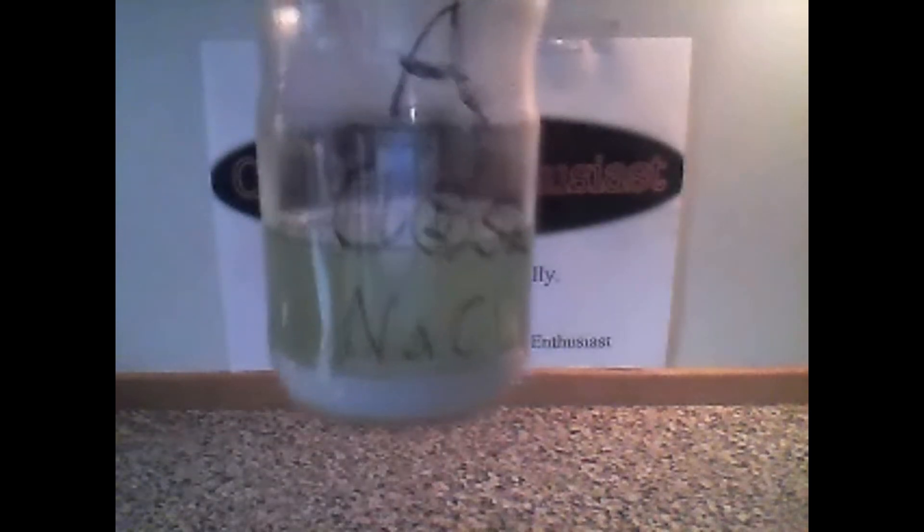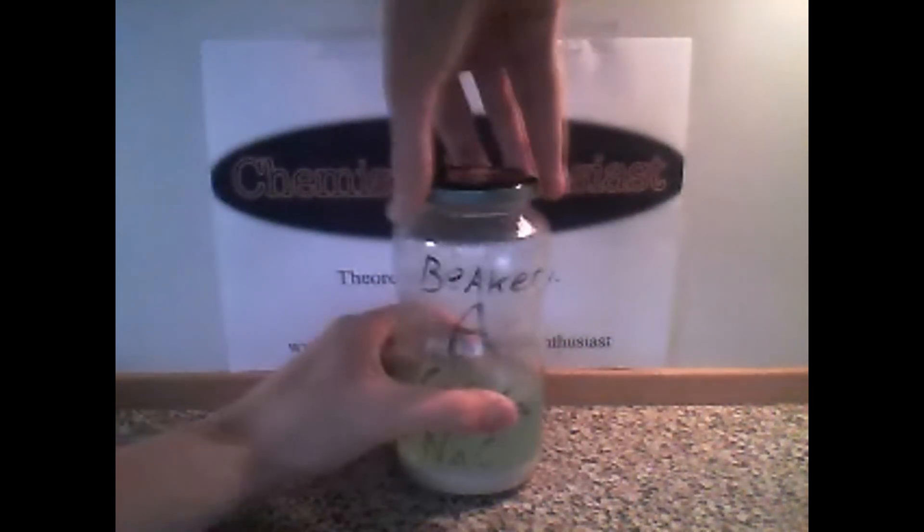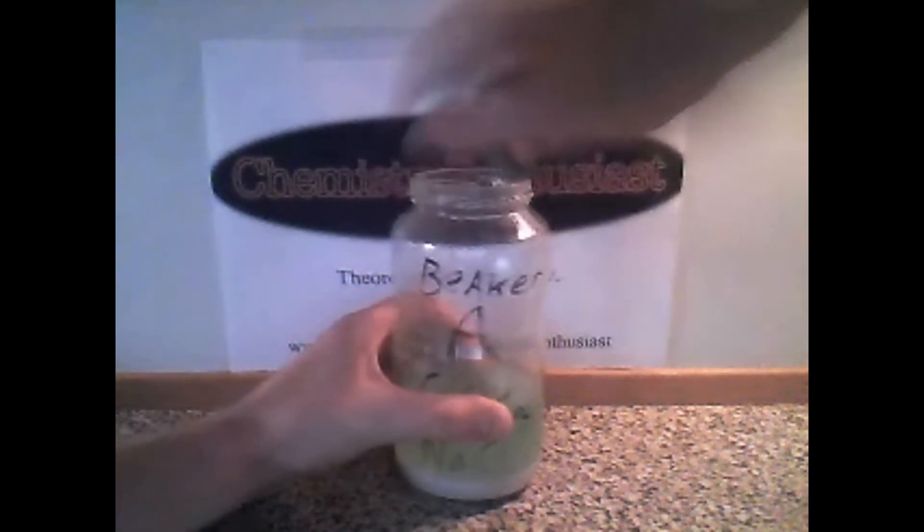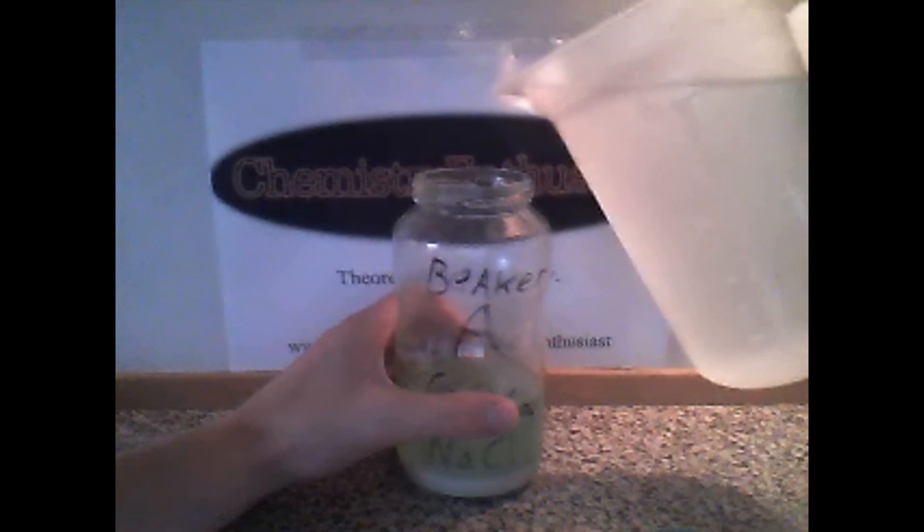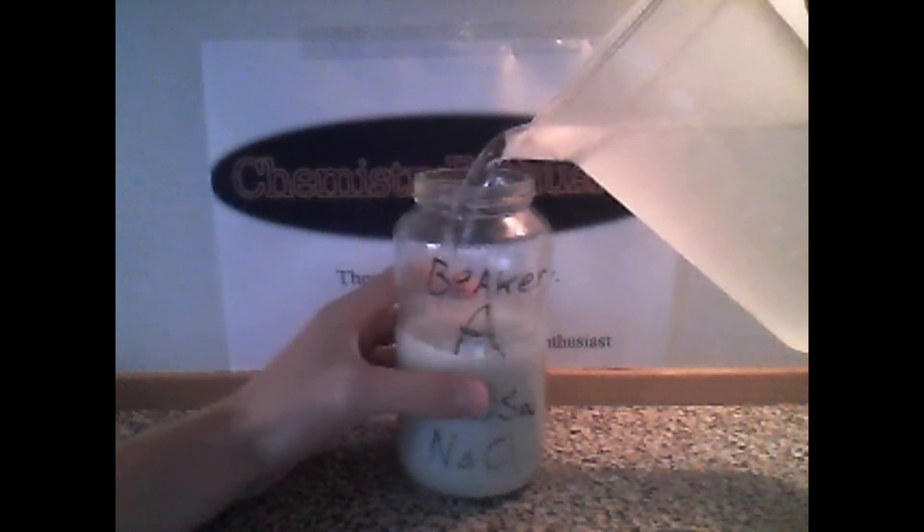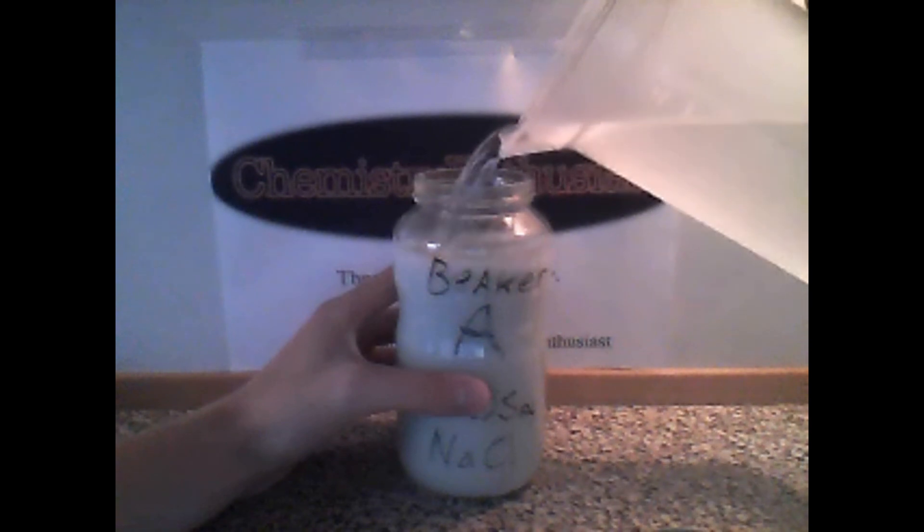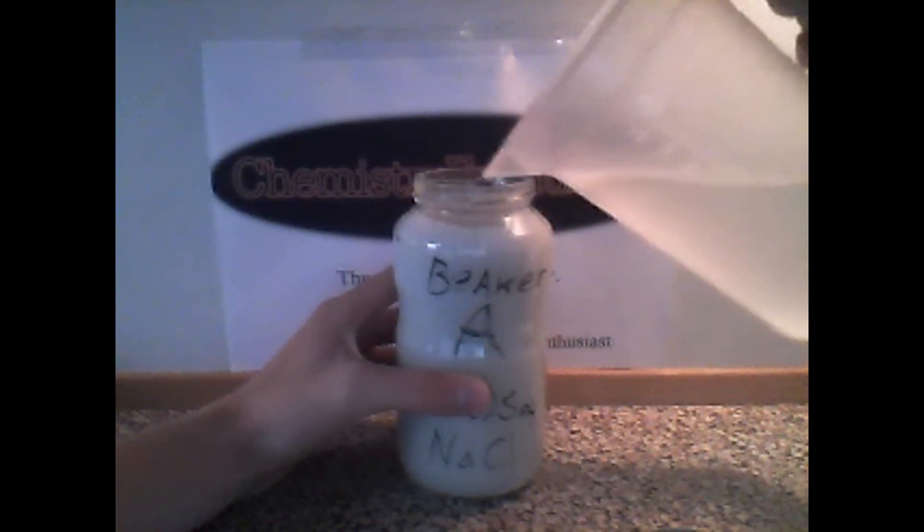Okay. Then wait 5 minutes for the chemicals to react. At that time all the chemicals have fallen down to the bottom. Okay, now unscrew the lid of the beaker and fill the beaker with cold water to prevent the chemicals from reacting with the oxygen in the water too quickly.